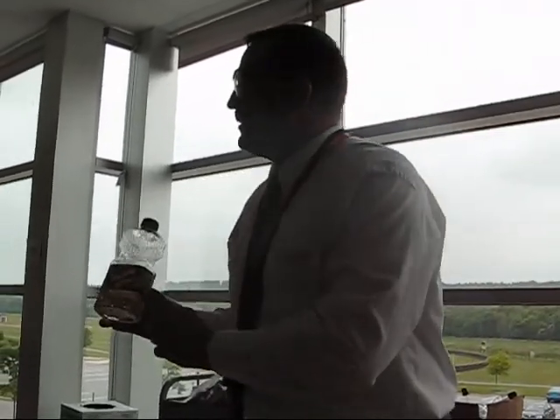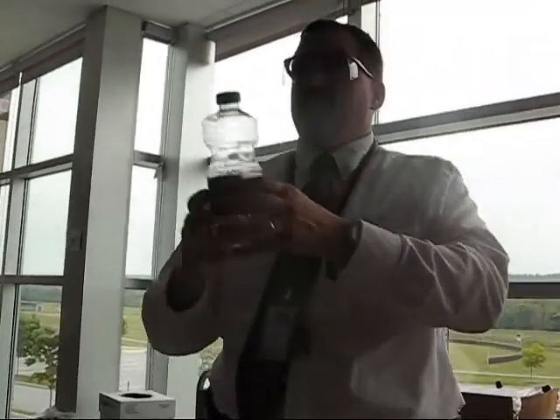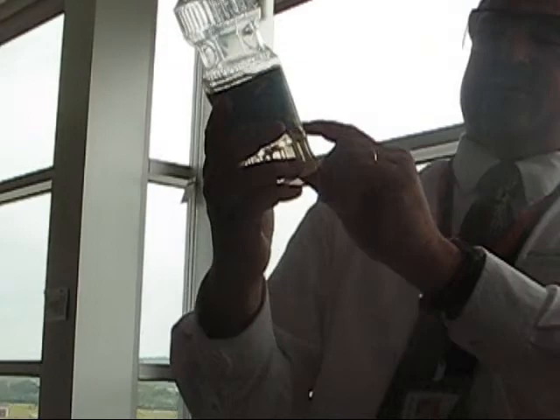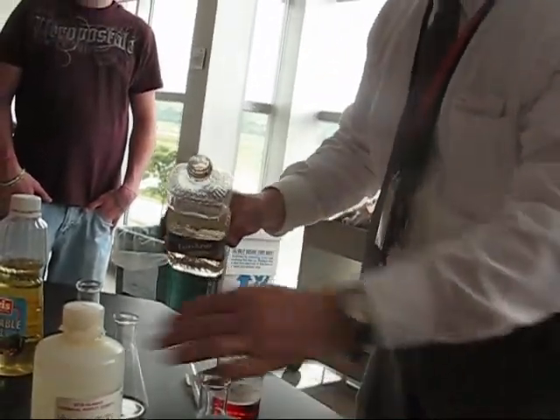If you want to buy a designer fat, you can buy safflower oil. It's pretty expensive. This other stuff is just straight run vegetable oil. But safflower oil is like a designer oil. Sometimes they show the flowers. They press the safflower seeds and get this oil out. Now it's unsaturated. You can tell it's unsaturated from this test.